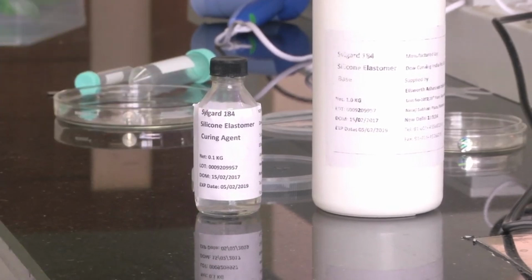Once we mix it, we have to stir it continuously for 10 minutes so that they get mixed properly. In the stirring process, lot of air bubbles will be formed in the mixture, but air bubbles should not be there in our membrane because we need it to be a very clear transparent membrane. Then this mixture we will keep inside a desiccator unit and depressurize it so that all the air bubbles will start coming out. That will need around 20-25 minutes. Once that process completes, we will get a very clear liquid of the PDMS curing agent mix.